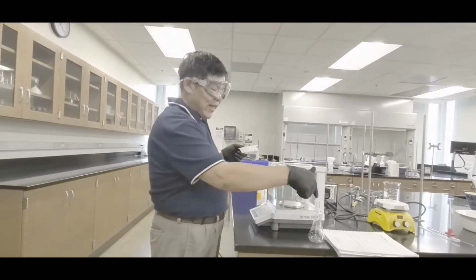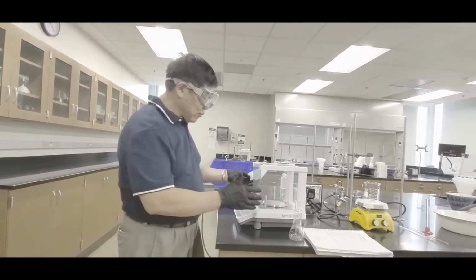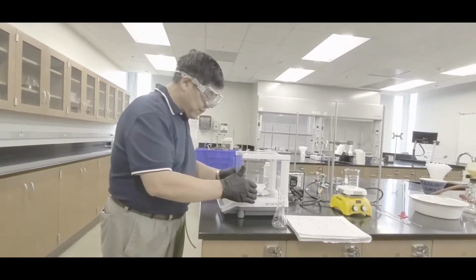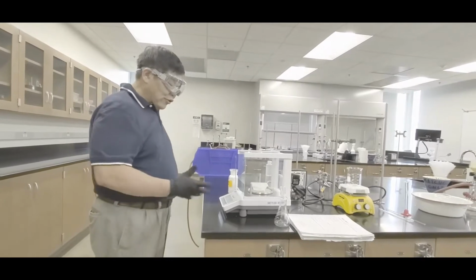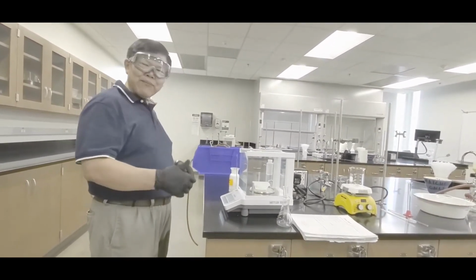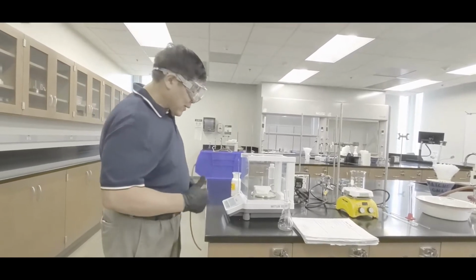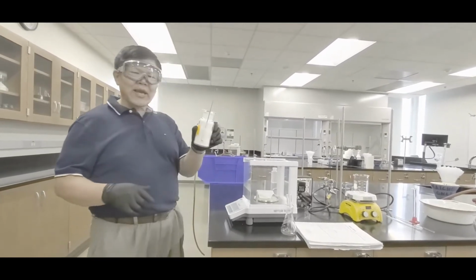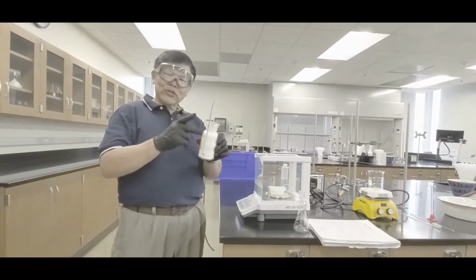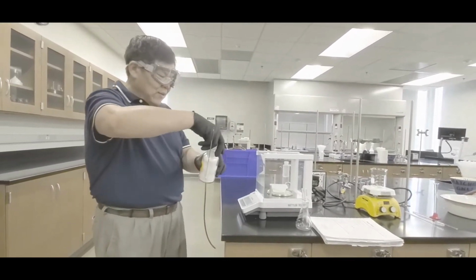What's important is what's in there, yeah? So here we go, here's a boat, and what I'm gonna do is park it in there, and there's a number, but you don't care about that number. In that case, push 0, okay? So that sets that at 0. Now what you then do is, here's the salicylic acid. You guys be careful with this. This stuff is corrosive, okay?